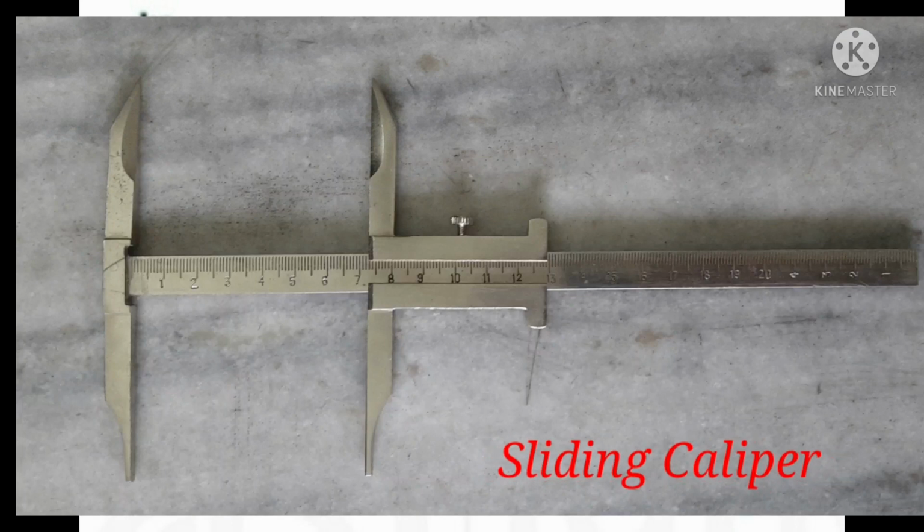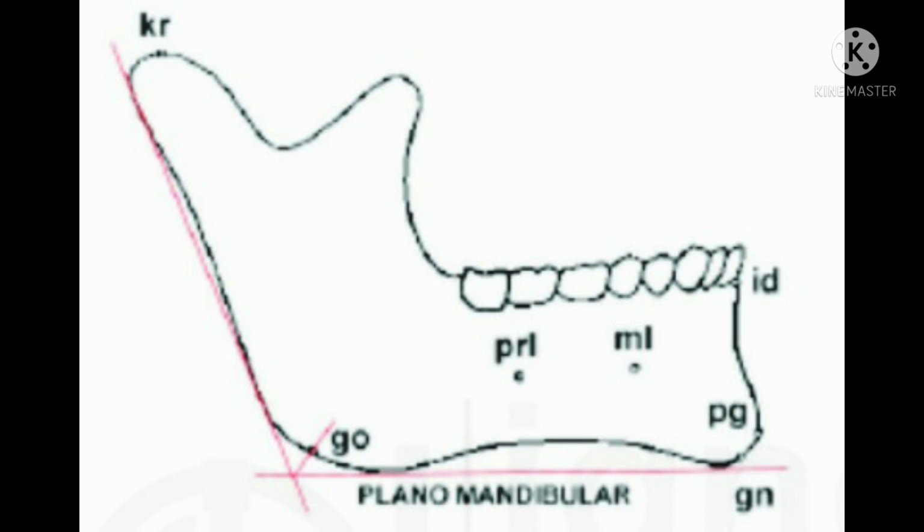For this measurement, a sliding caliper is used. Before taking this measurement, first we have to place the mandible inverted on the cushion and adjust the inner border of the crossbar of the caliper on the lateral surface of the mandible. Then we place the end of the fixed crossbar against the most laterally placed point of one of the gonion, and slide the movable crossbar to the other gonion to take the measurement.